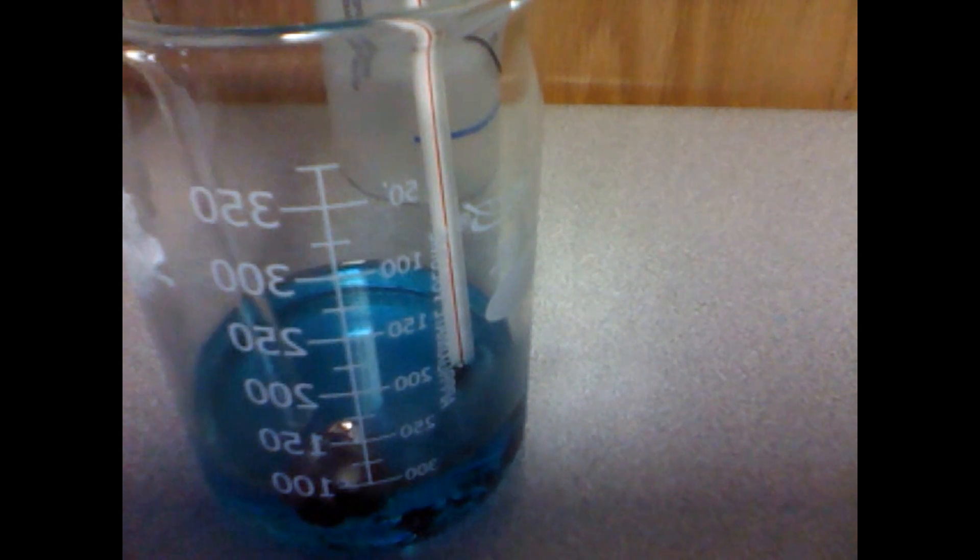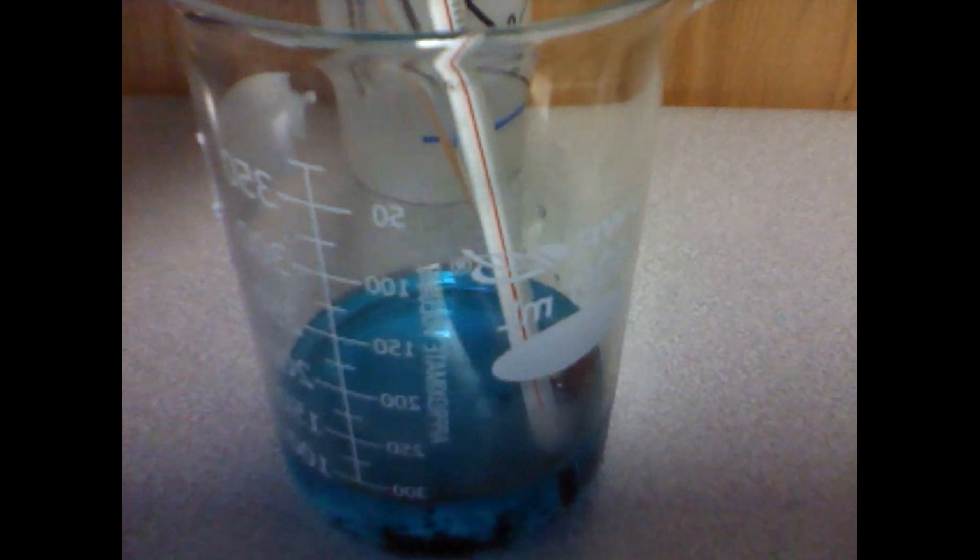The temperature is now 29 degrees Celsius. After this observation, the foil is giving off a sour scent. During this procedure, you want to make sure that you write down your observations carefully.